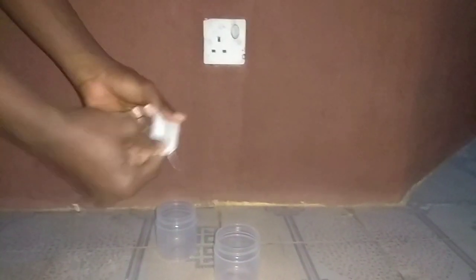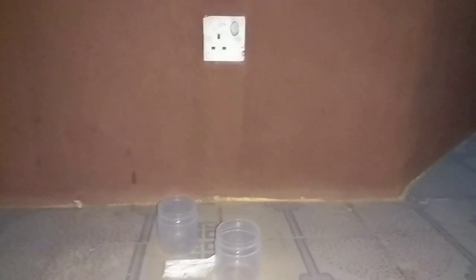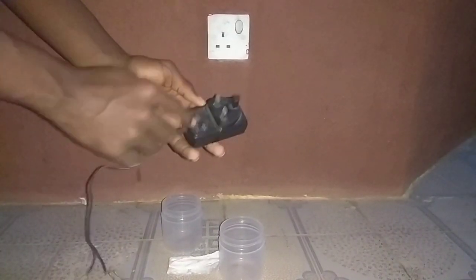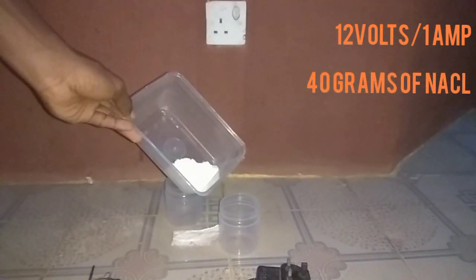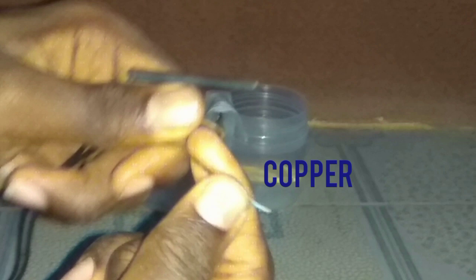I have these two suitable containers I'm going to use. I have this fabric — I'm going to use it as my salt bridge. You could use toilet paper or butter paper. I have this socket and this wiring which is giving me 12V / 1A output. And I've already measured out 40 grams of sodium chloride salt. This is my electrolytic setup. I want you to look at my electrodes — this is copper, serving as the cathode, while this carbon here is serving as the anode. I'm going to do a detailed explanation of electrodes and electrolysis, but I chose these two electrodes for this particular experiment.